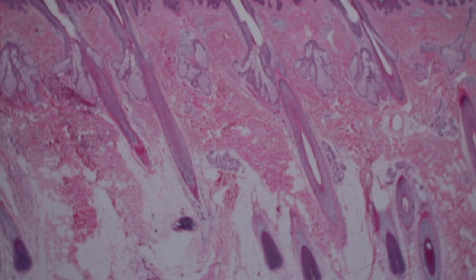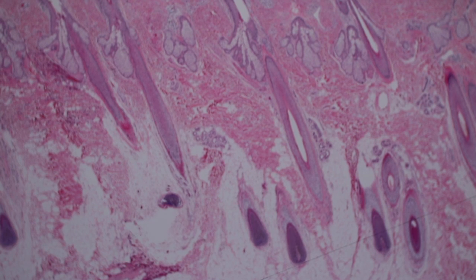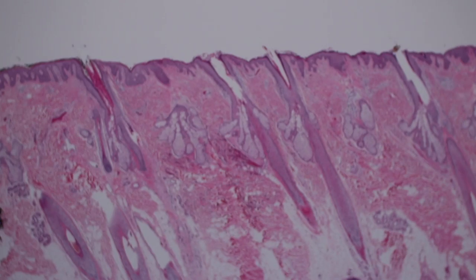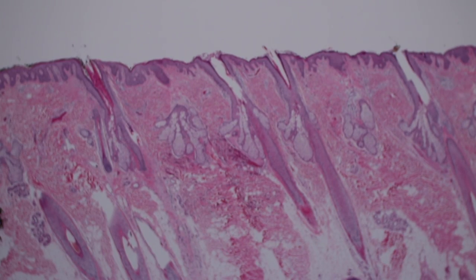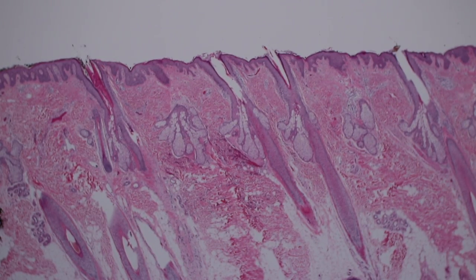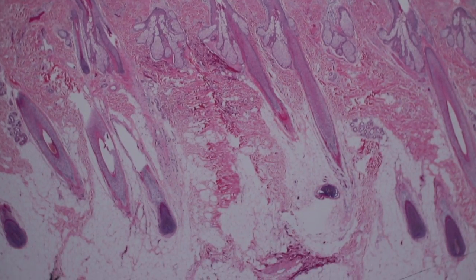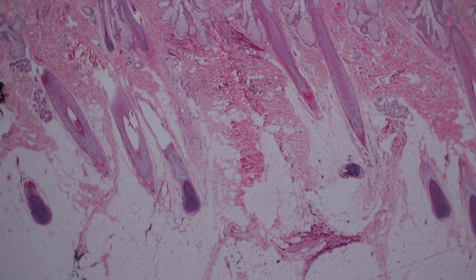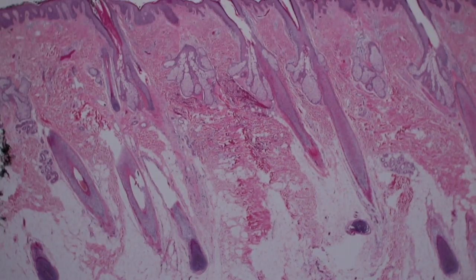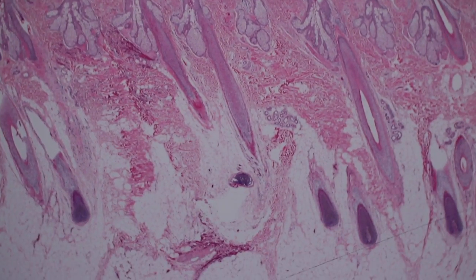Now this is beautiful — this is the scalp. Even at the lowest possible power on the scope, trying to get into focus, you can't even see all of it in one field. That's because these giant hairs go all the way down.